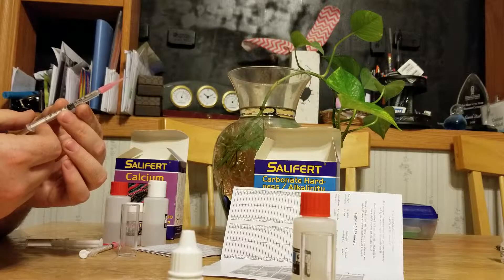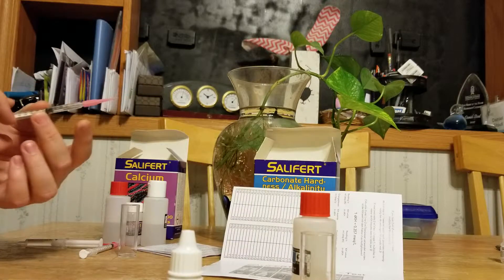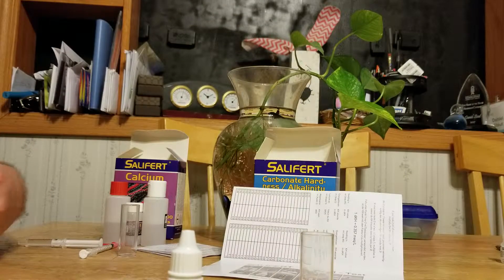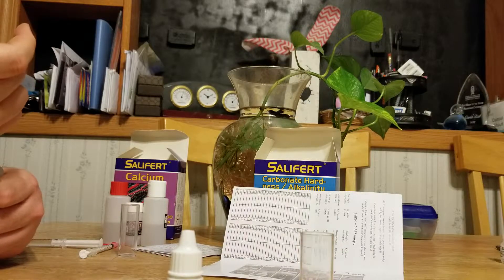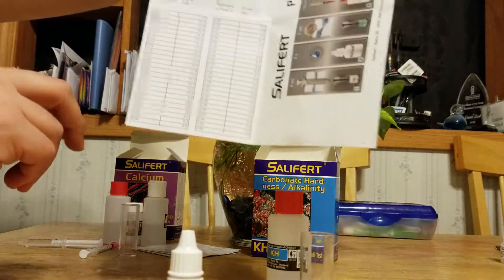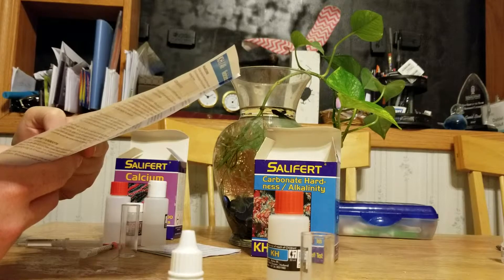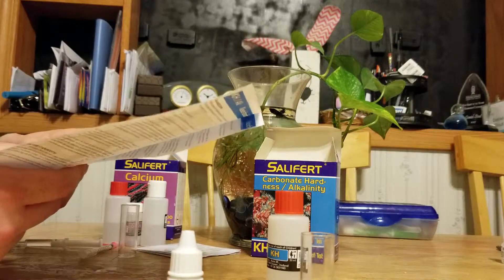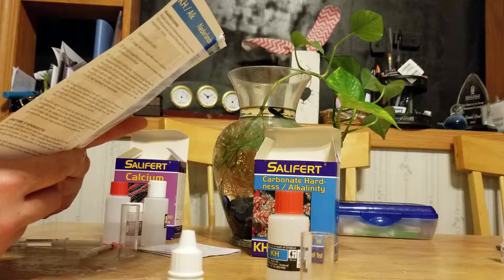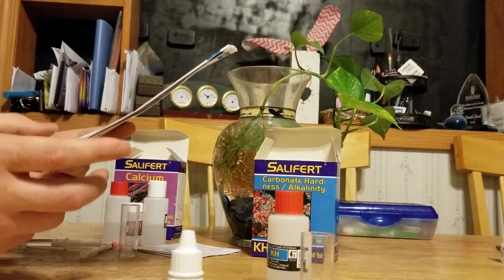What's left in the solution is 0.46. That's what's left, so I can put this back — I always save the solution, no point in pitching it. Then I go to this chart they gave you to see what your dKH is. Point four six puts me at a dKH of 8.3. I'd really like to be up in the nines — low end is about 7, high end is about 11 — but we're in range.